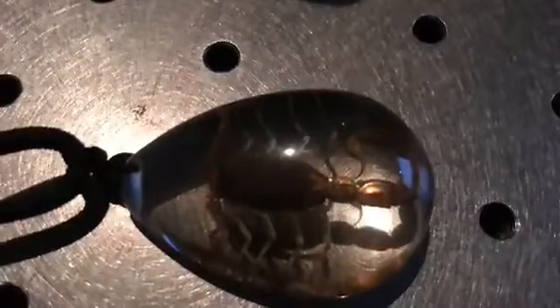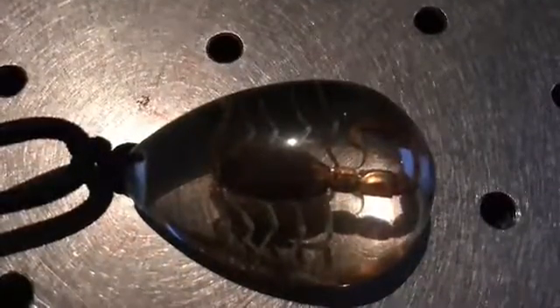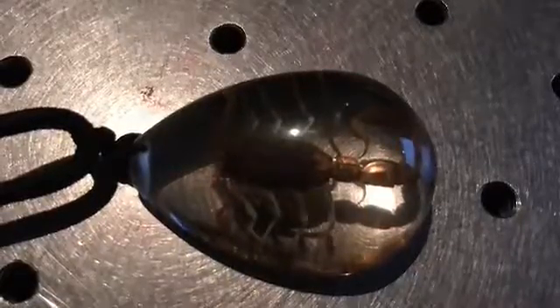One thing we did like about this lab was using the UV laser to see all of the samples fluoresce. One thing that we didn't like about this lab was that even with every source on it, the scorpion did not fluoresce at all. I don't know what happened.